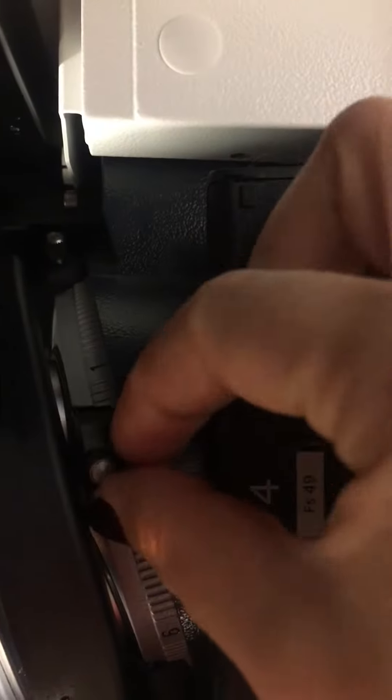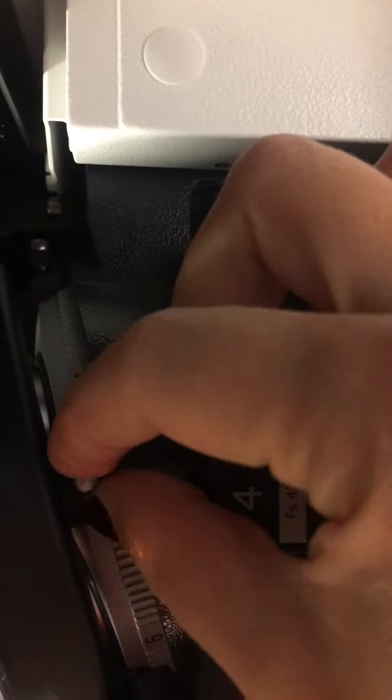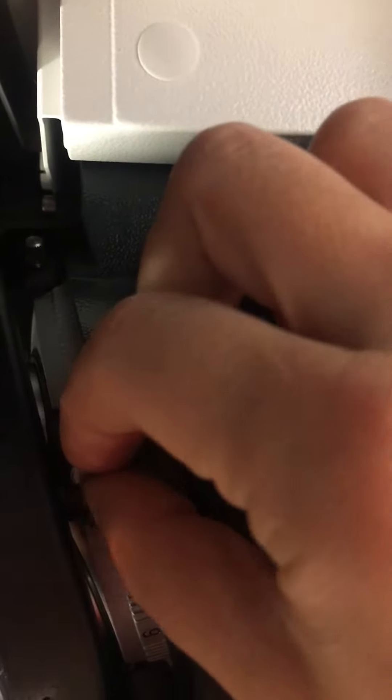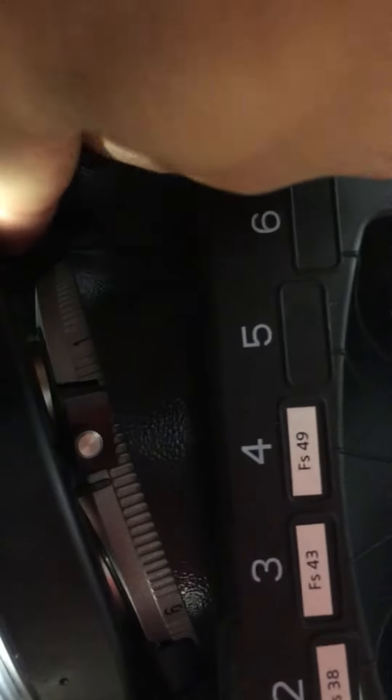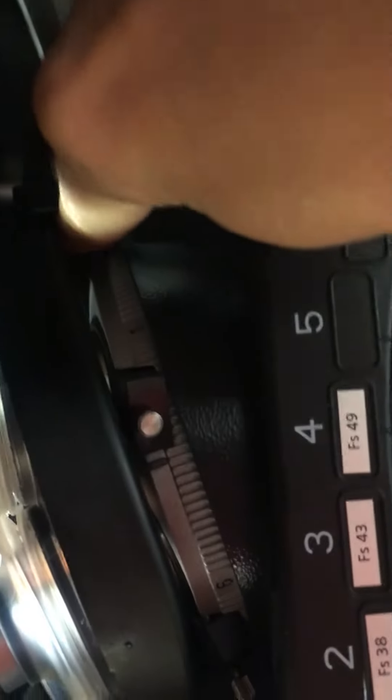You can see that there is a tiny metal screw which allows you to tilt the second NOMARSKI prism, and if you have ultra thin fingers you probably can even do it in work position.